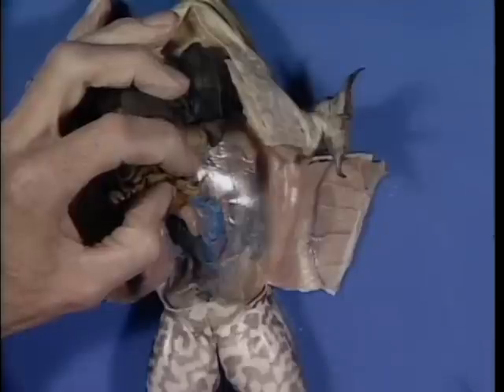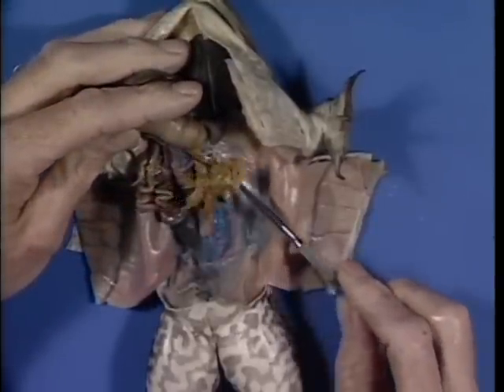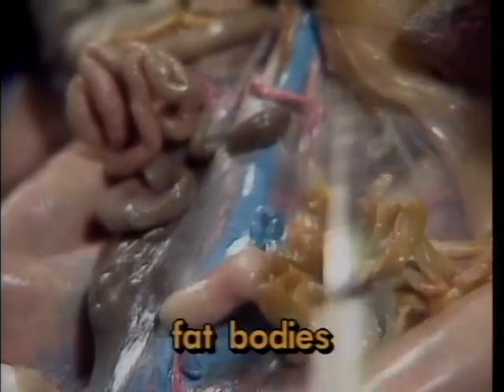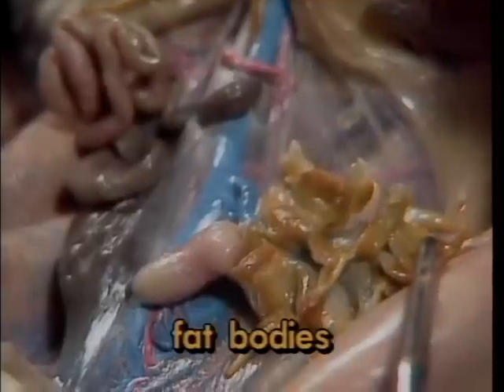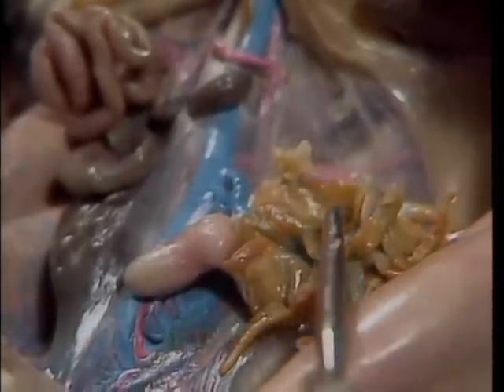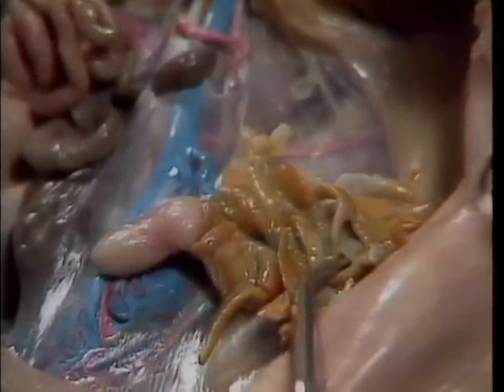Associated with the reproductive system of both sexes is a large series of yellowish finger-like objects. These are fat bodies and represent stored energy to be used only during the spring reproductive season. Fat bodies are present in the frog throughout the winter. They are used up during the breeding season and then replenished before winter sets in again. Most specimens will show these structures.